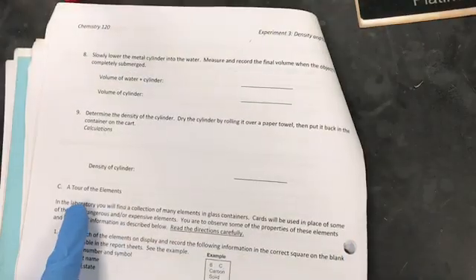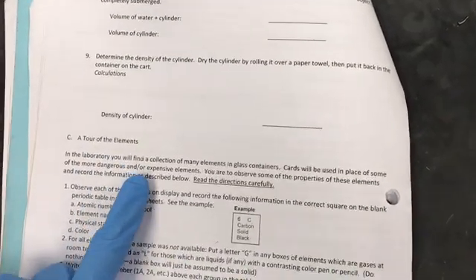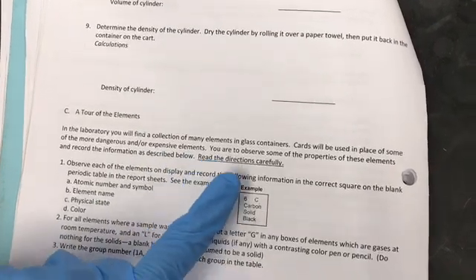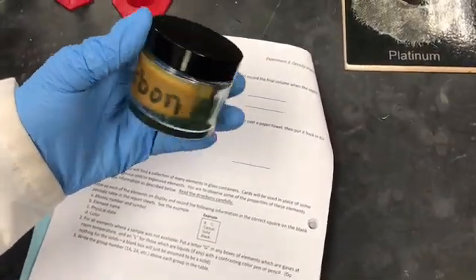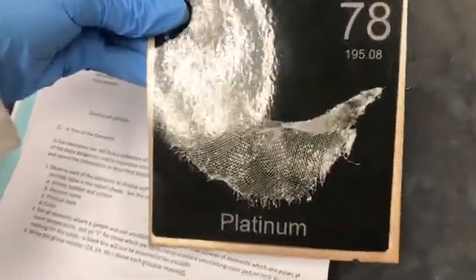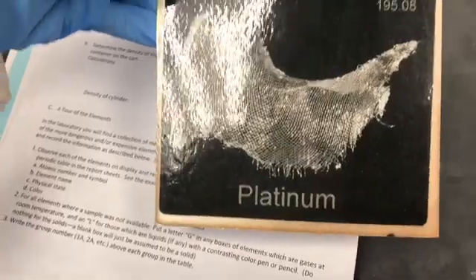The second part of the experiment is tour of elements. You will be seeing many different elements in glass containers or in the form of cards. Here is an example — this is carbon in a glass container. Some elements are shown on cards because they are expensive or dangerous elements. For example, platinum is shown here on a card.